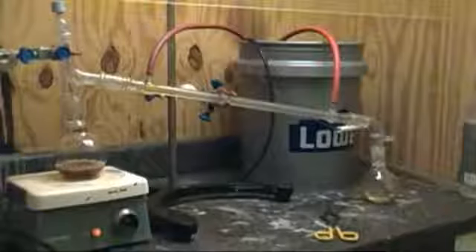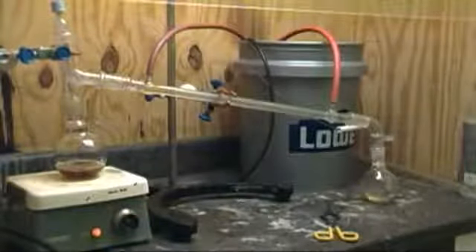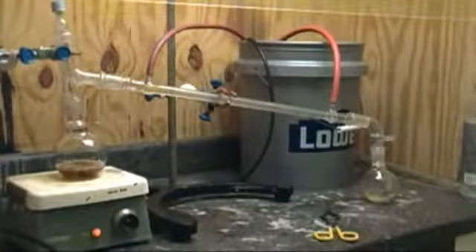Once cooled, disassemble the distillation apparatus setting the flask of aniline aside. Wash all the other parts with water and acetone. Then use a heat gun to remove any residual moisture. When everything is dry, reset up for simple distillation and again turn on the heat. The aniline distills over at 180 degrees C, leaving behind any impurities.